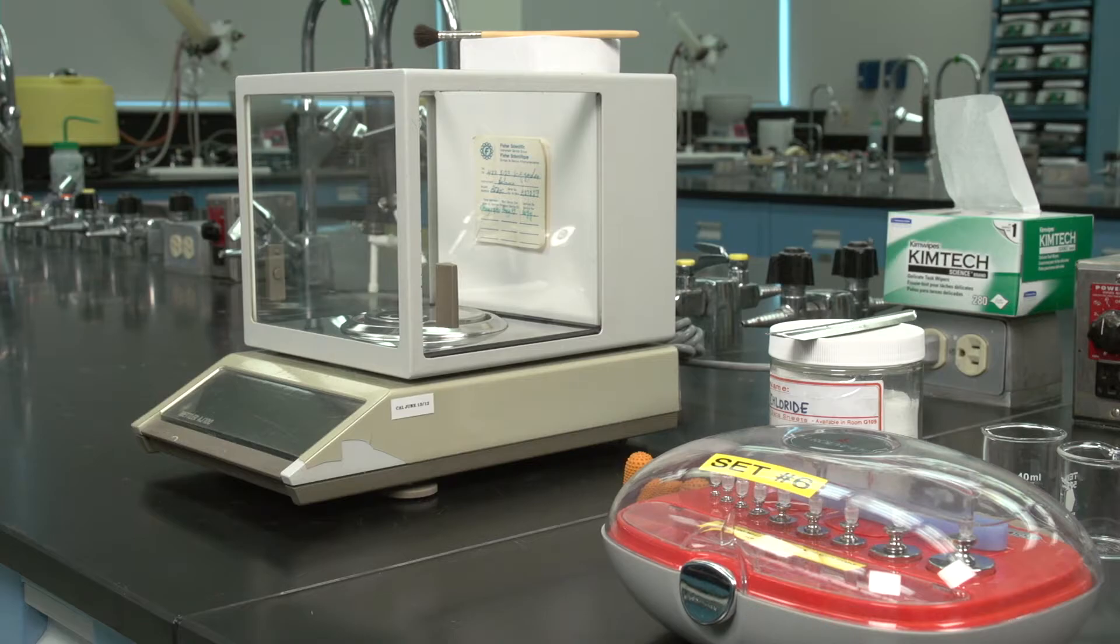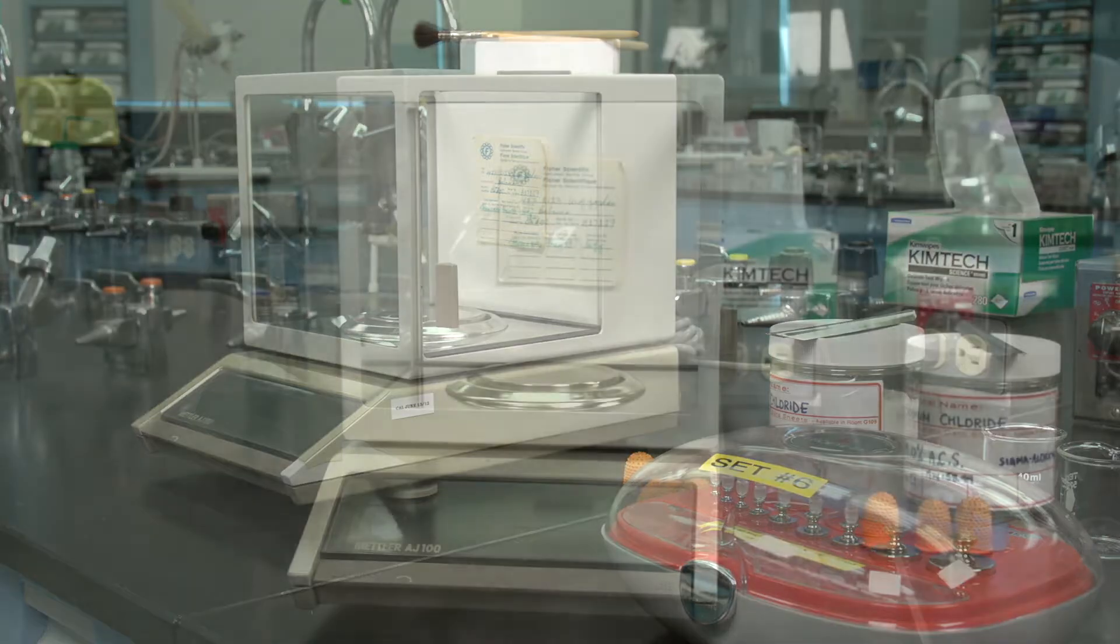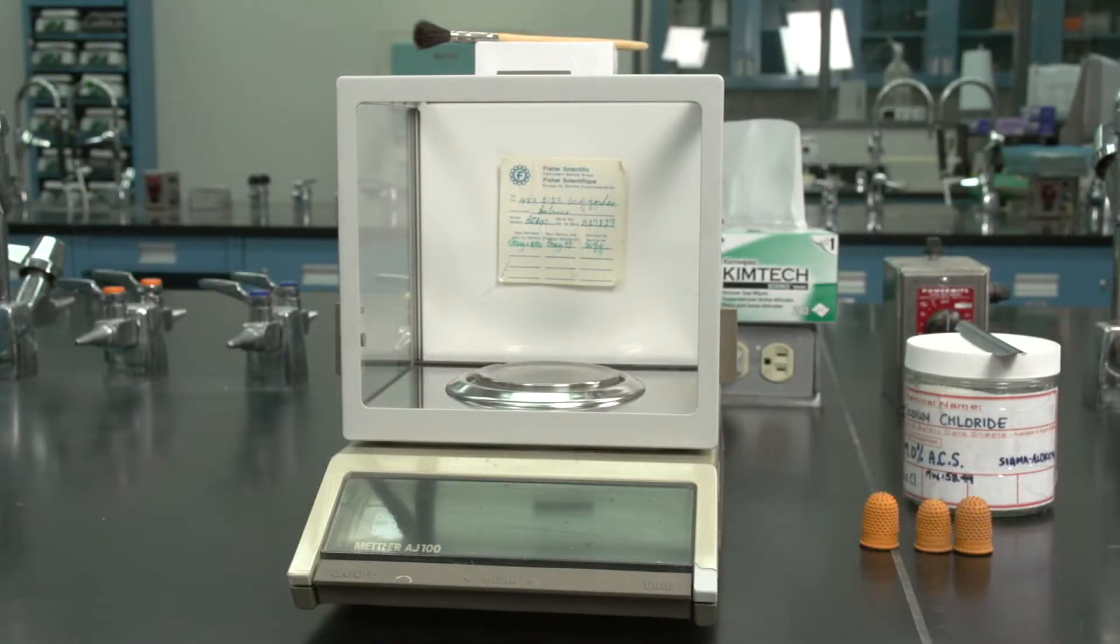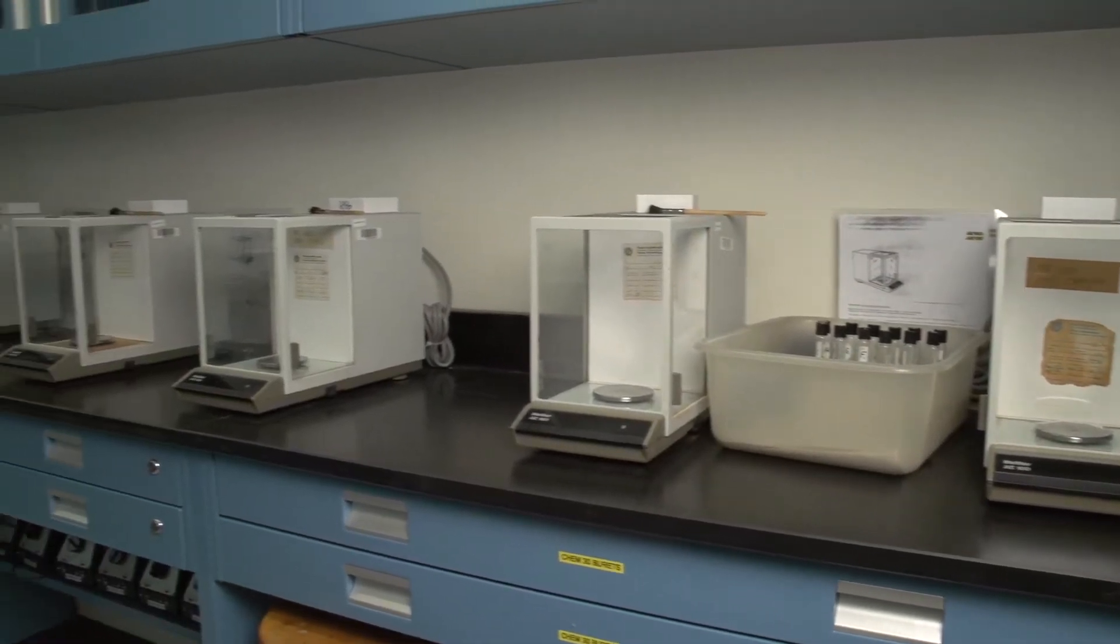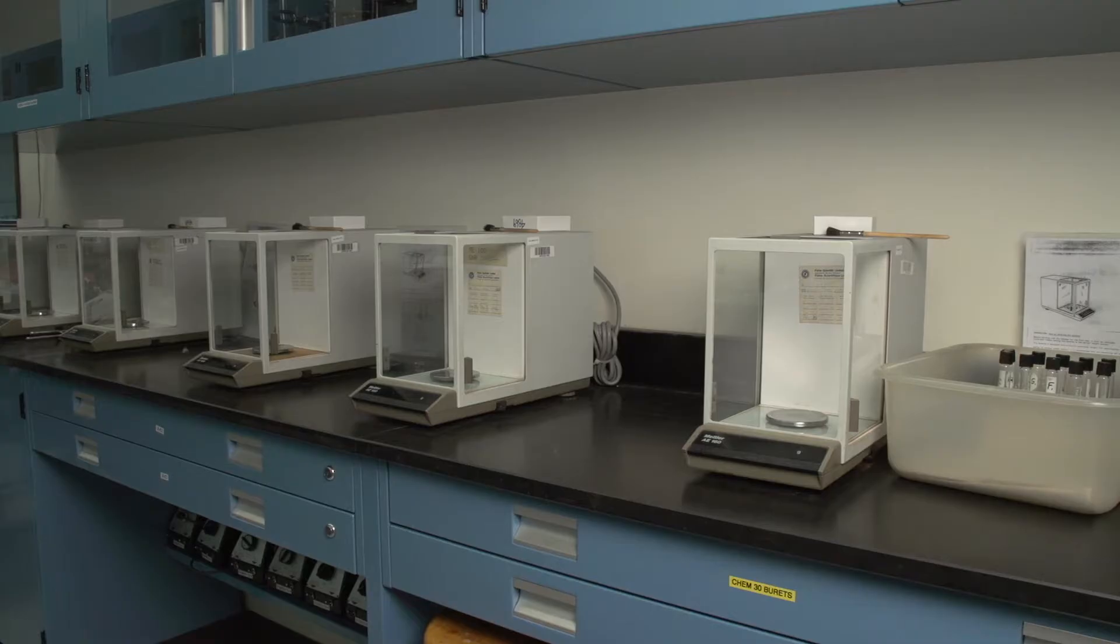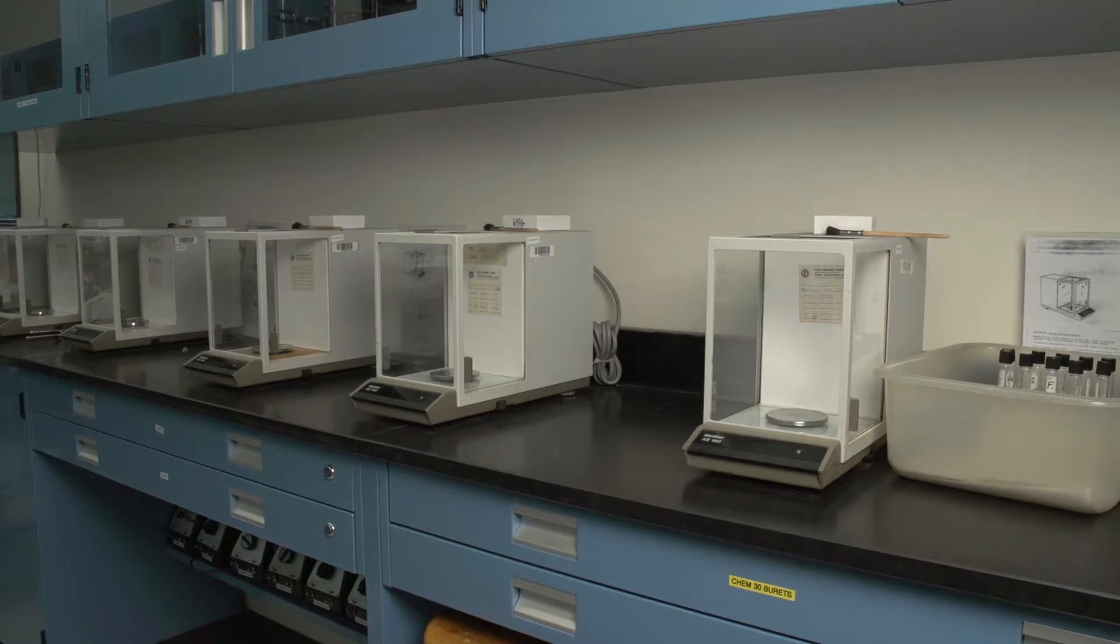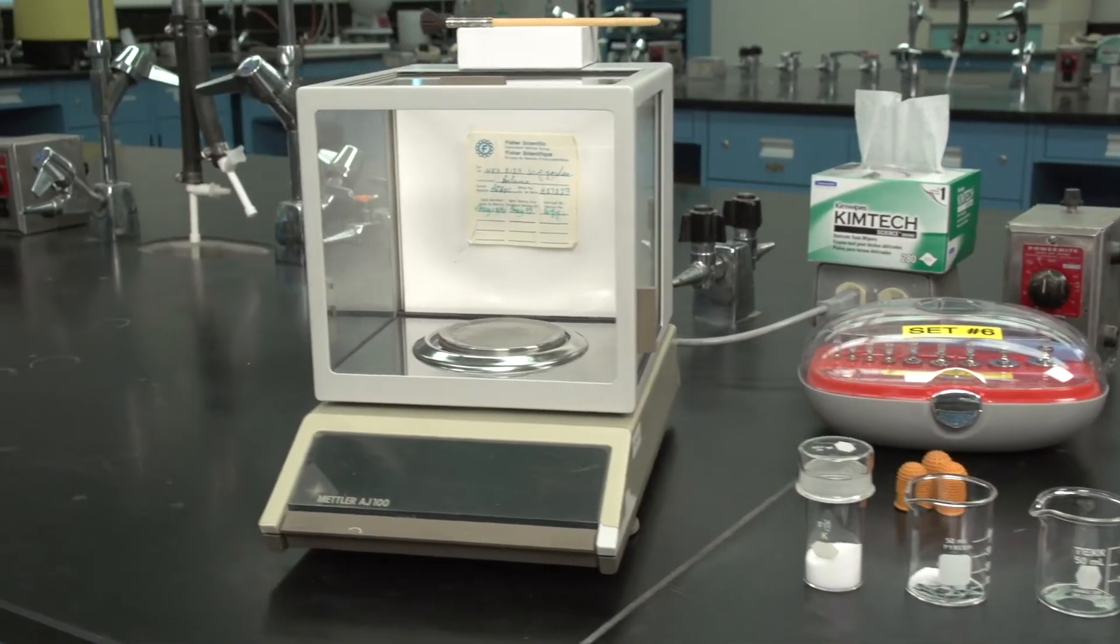Analytical balances are sophisticated measuring devices and must be used and cared for as recommended by the manufacturer. Balances are placed in a permanent location on a firm surface where they will not be disturbed by any other laboratory activities, drafts, and vibrations.